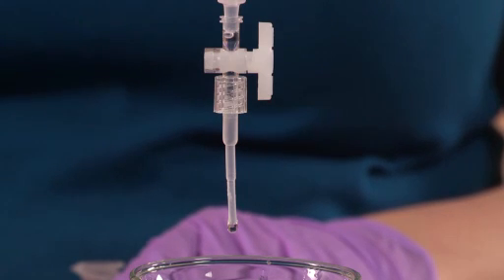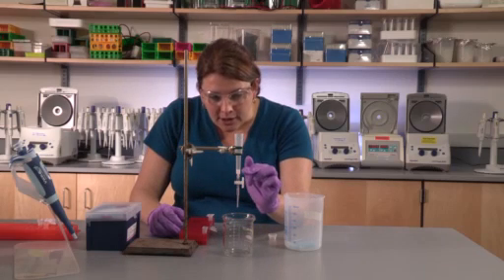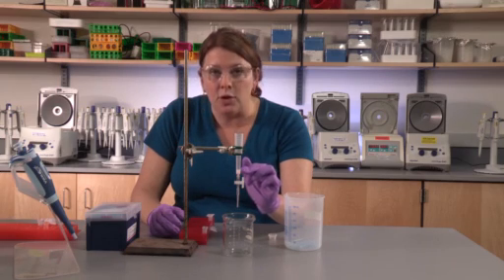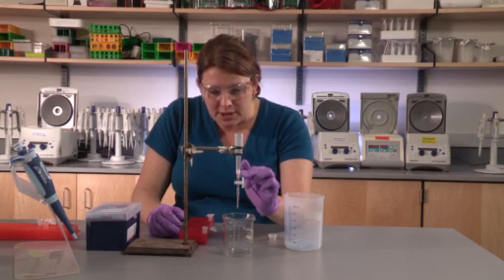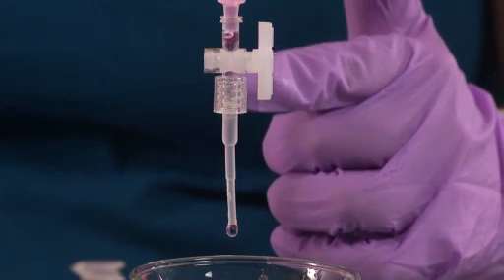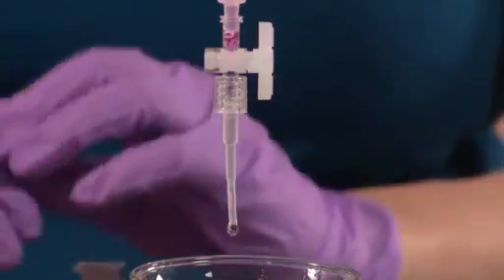Keep an eye on the progress of the red fluorescent protein as it exits the resin of the column. You'll notice that the pink color will begin to disappear, and the red fluorescent protein will enter the bottom of the column and drip out at the end.